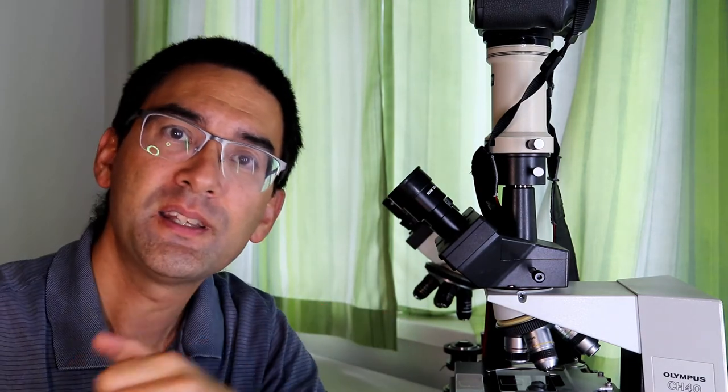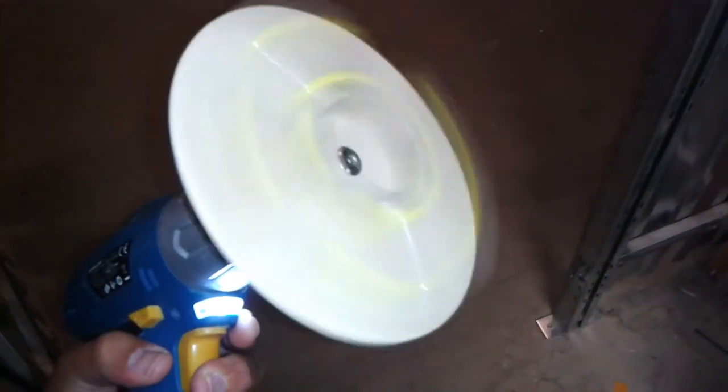Now, if you don't have a hand centrifuge like this, what you can try to do is you can try to make one yourself. I tried to make one myself. I did not test it yet. I'm also going to do that.